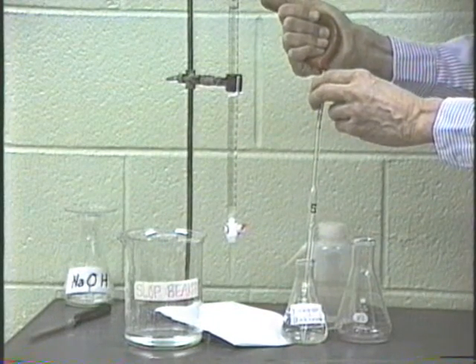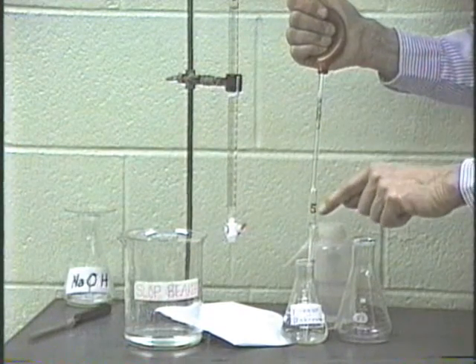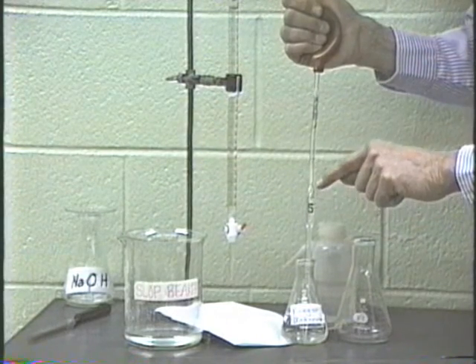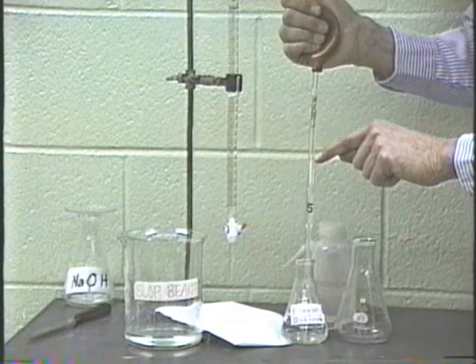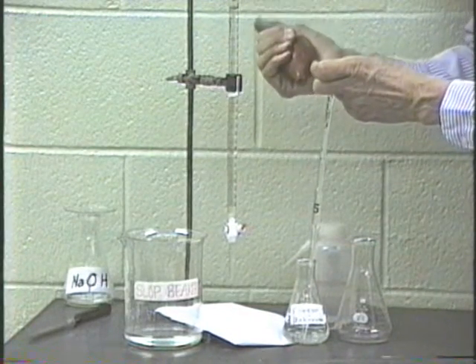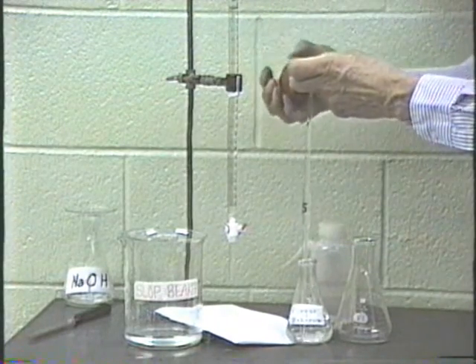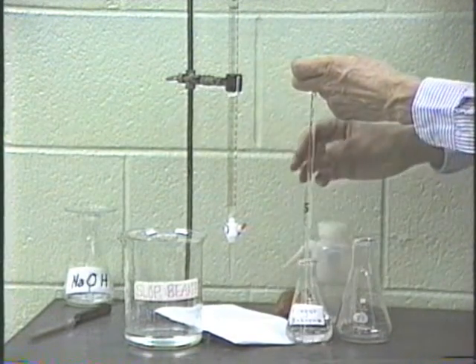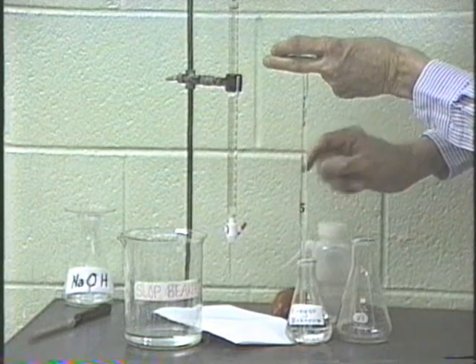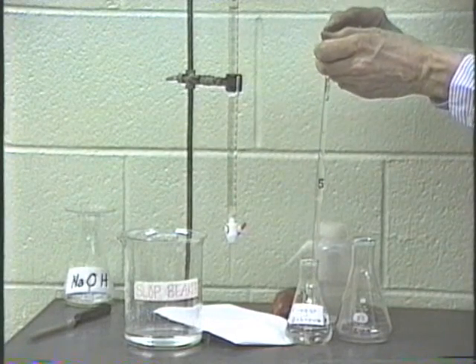Now, to fill up the pipette, squeeze the bulb, just slip it on, and draw up the liquid. Here's the liquid level coming up here. This is the 5 milliliter mark, and now it's past that mark, bring it, but do not let it go into the rubber bulb. Whatever you do, do not let the liquid level go into the rubber bulb. All right. Once you have the liquid level, oops, it's way up here, past this mark, then just take and hold it in place with your thumb here.